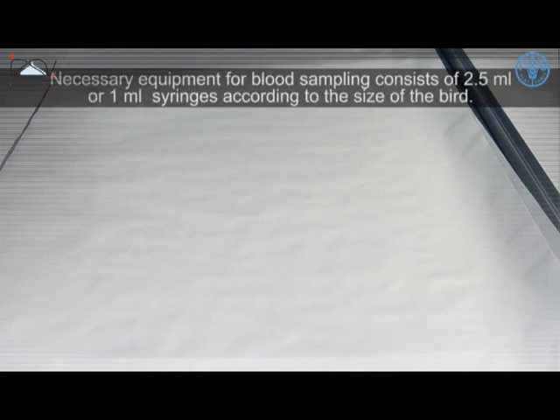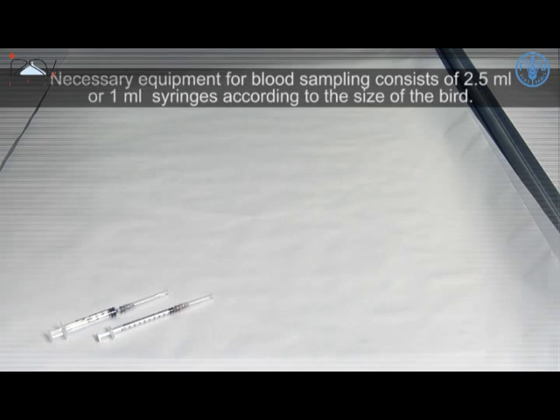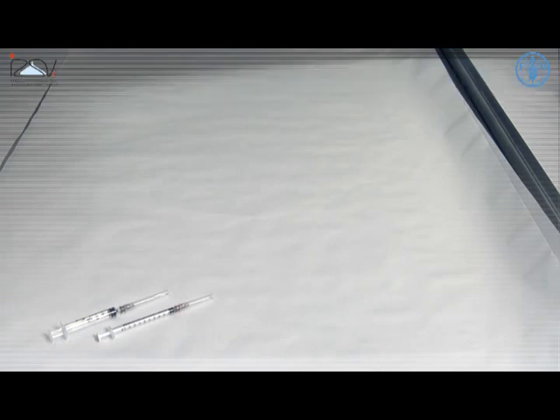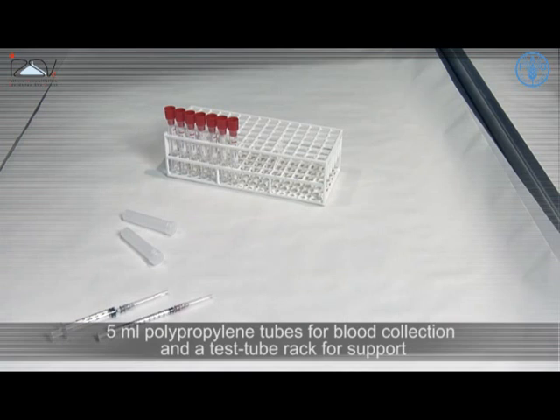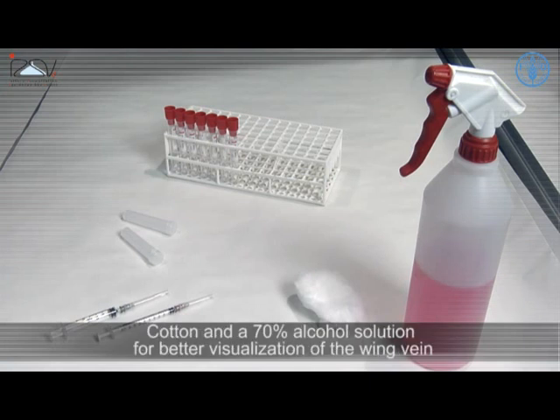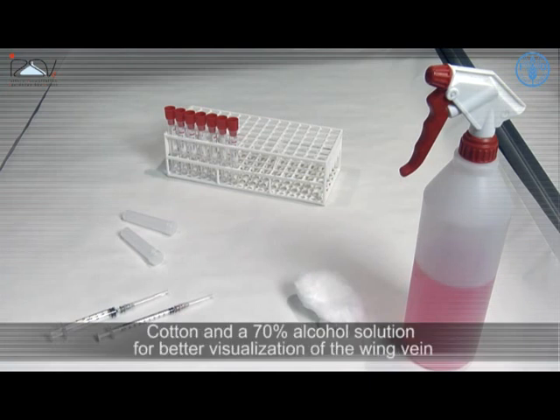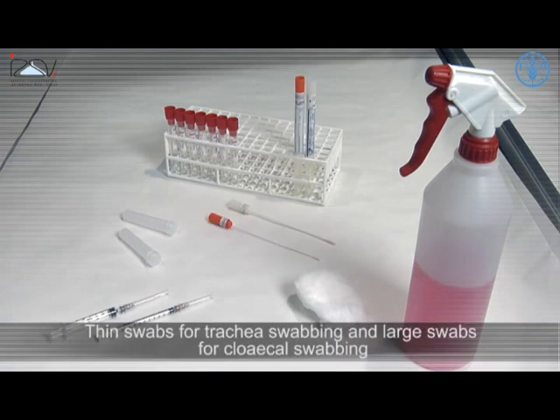Necessary equipment for blood sampling consists of 2.5 ml or 1 ml syringes according to the size of the bird, 5 ml polypropylene tubes for blood collection, a test tube rack for support, cotton and 70% alcohol solution for better visualisation of the wing vein, and thin swabs for trachea swabbing and large swabs for cloaca swabbing.